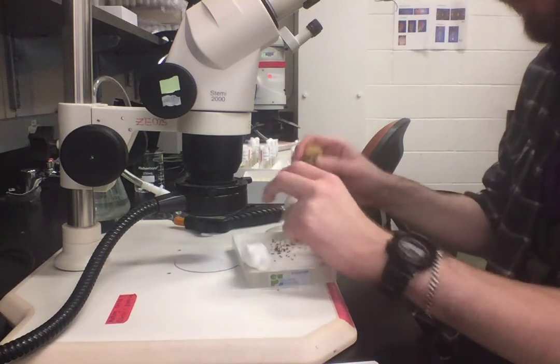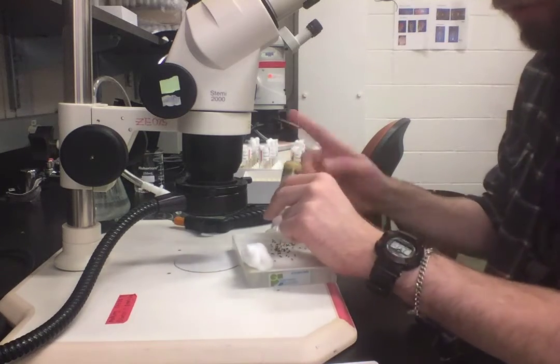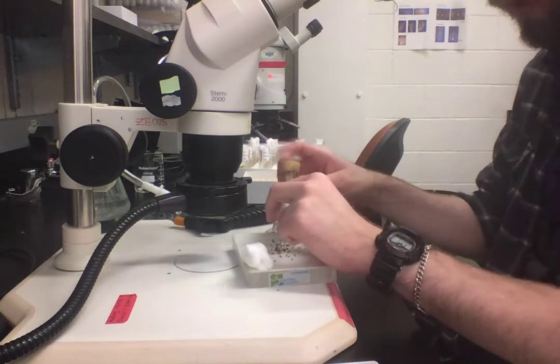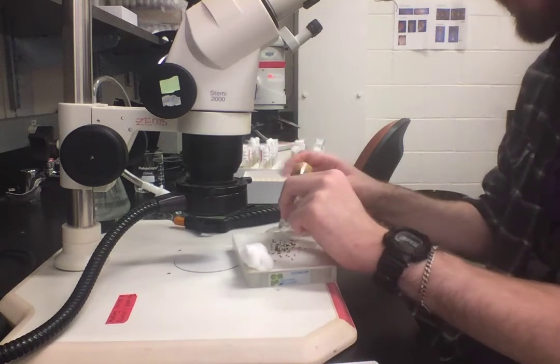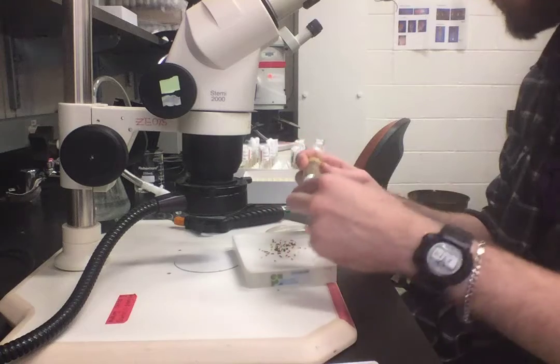You want to carefully tap out all the flies you can, and you really want to make sure you're getting all of the adults that were in that vial, so you don't want to miss any data.